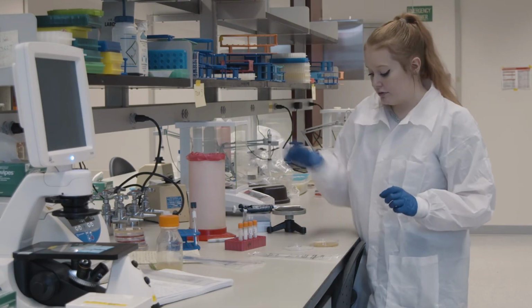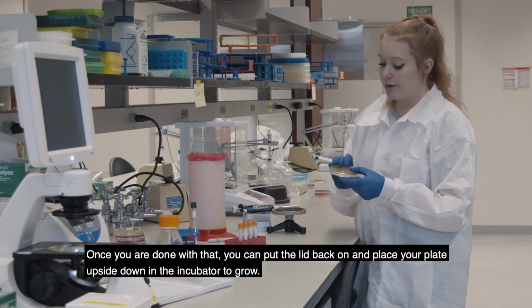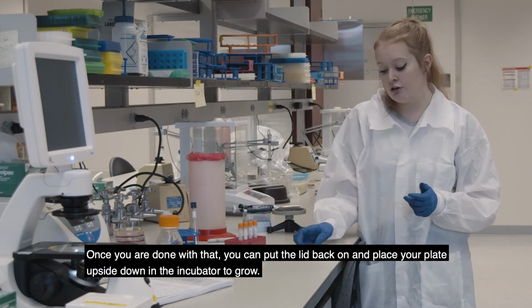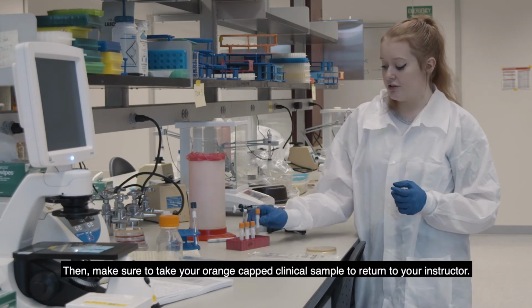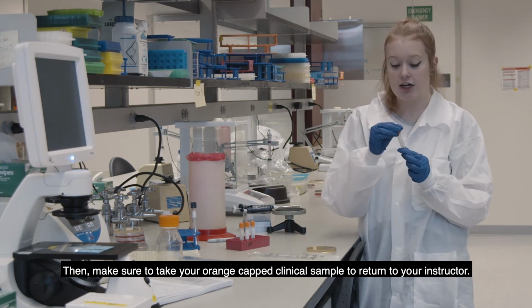And then once you're done with that, you can put the lid back on, and you want to place your plate upside down in the incubator to grow. And you want to make sure that you take your orange capped clinical sample and return it to an instructor.